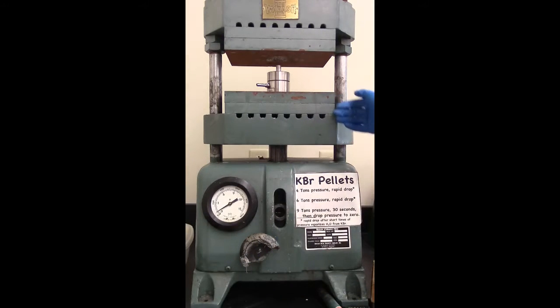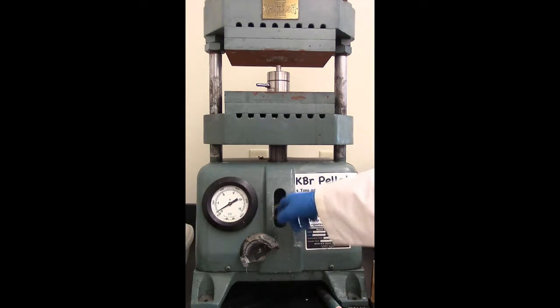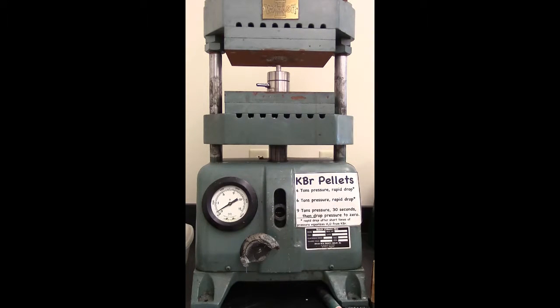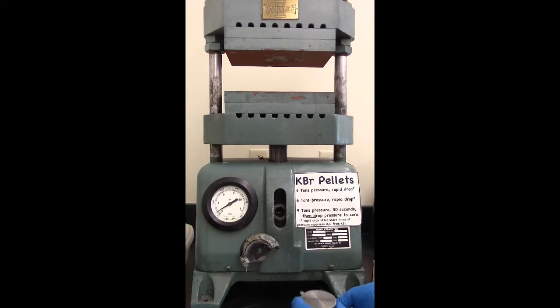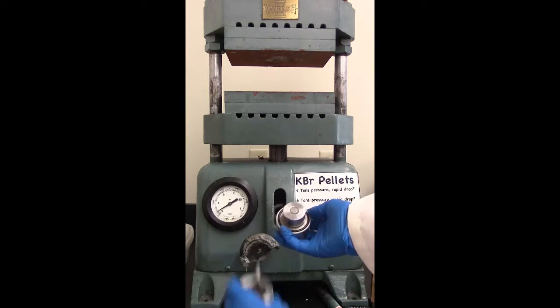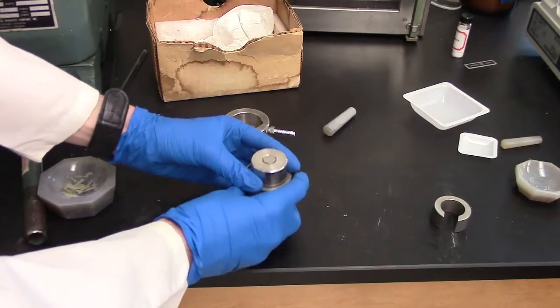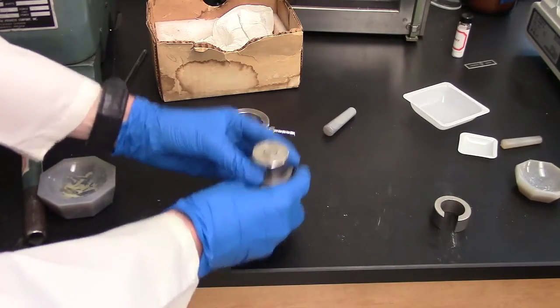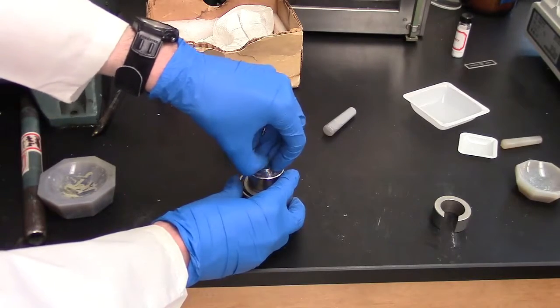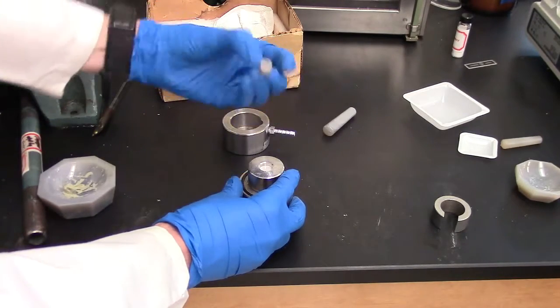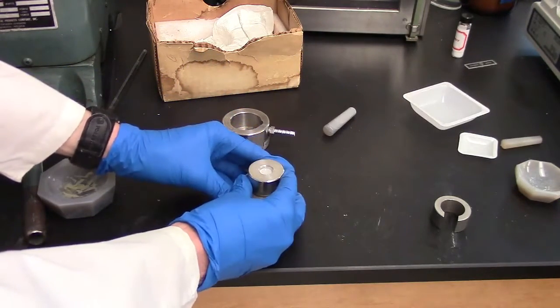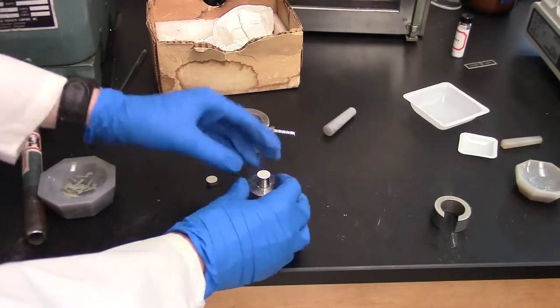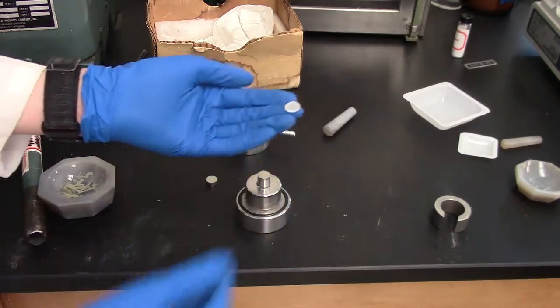And out of courtesy, don't drop it down too far. Otherwise it takes forever to pump this thing back up to a reasonable height. So we can take this off. Invert it. Pull off the top. I don't know if you can see that. Pull off the top. And carefully take the top part off. This top part here.